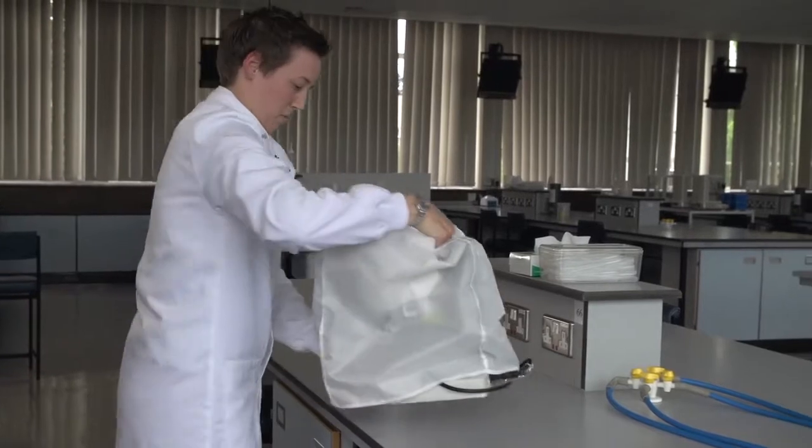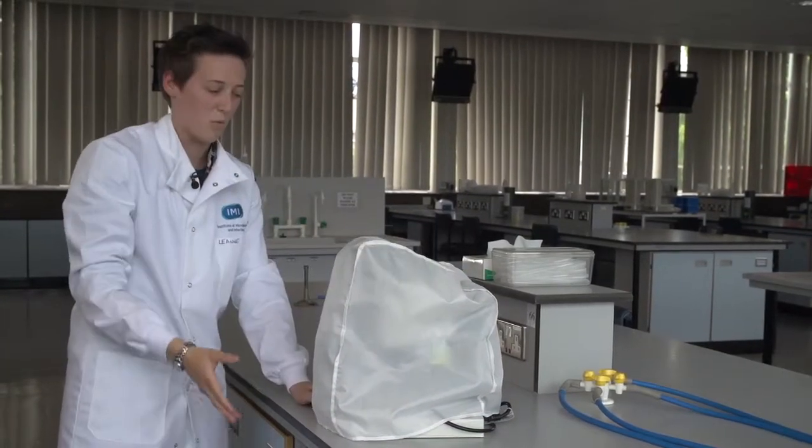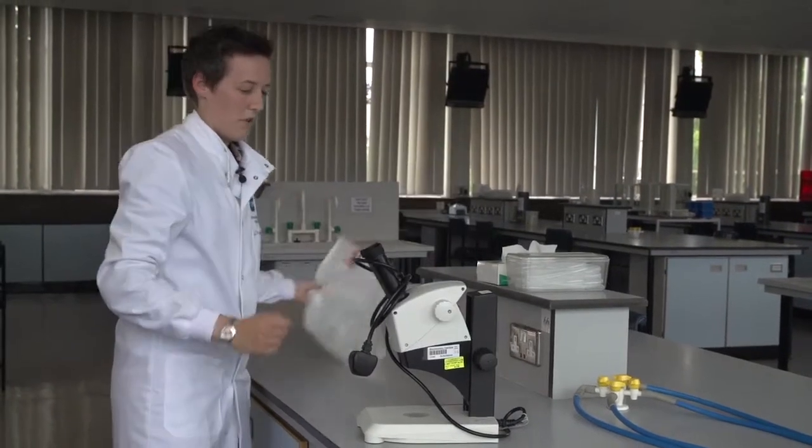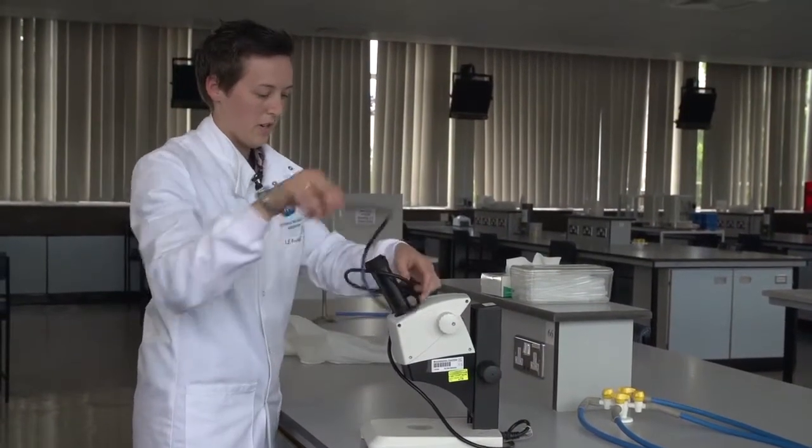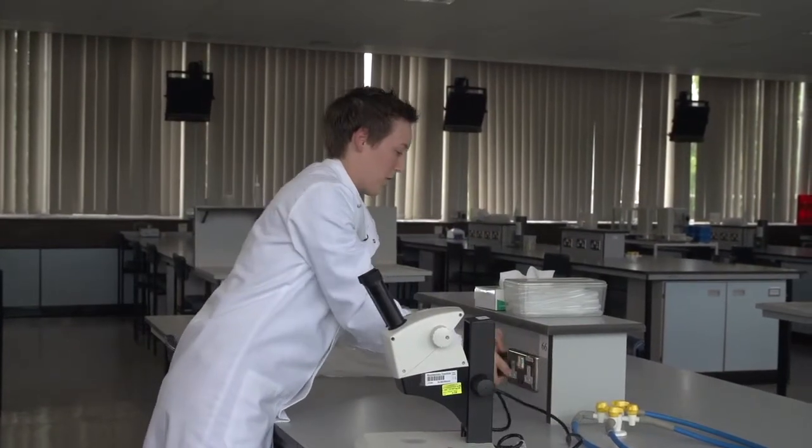We then want to position it on the bench in a place where you can sit and work at the microscope. You can take the cover off, take the cable off, plug in the microscope.